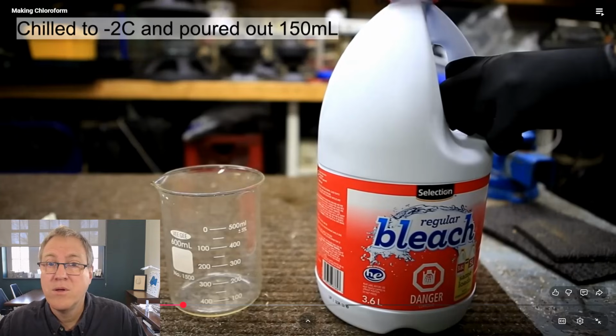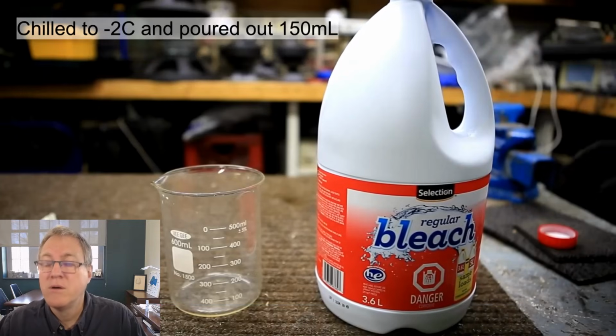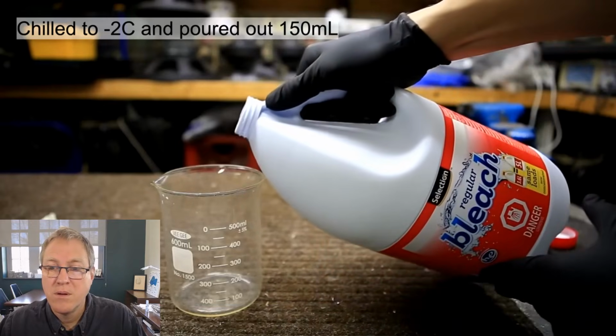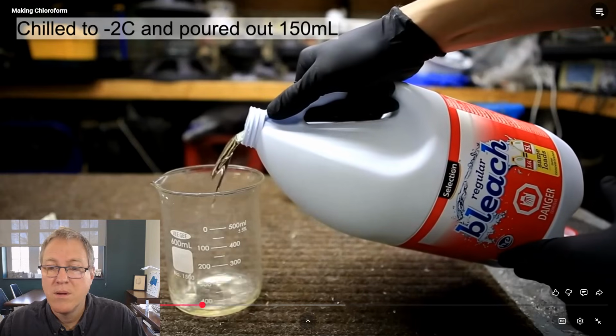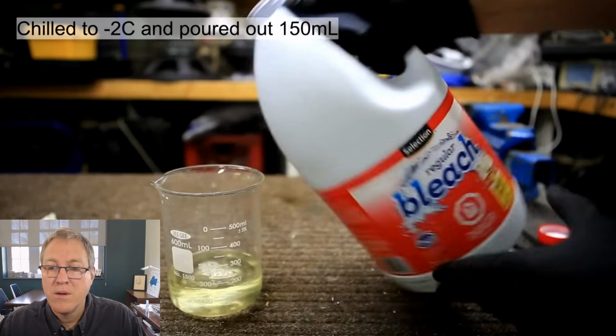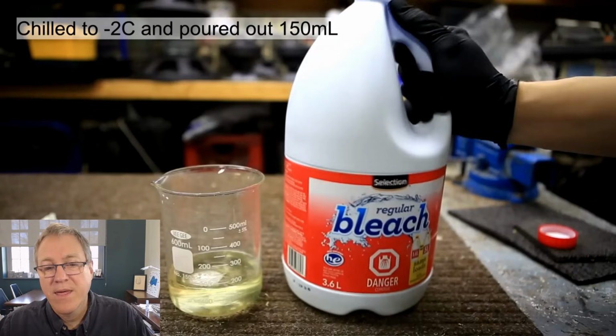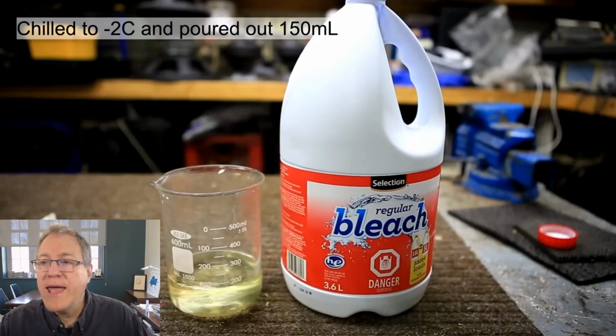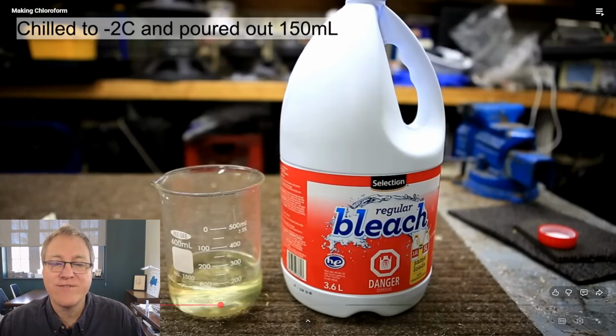The bleach was chilled to about -2 degrees Celsius and 150 milliliters was poured out. 150 milliliters is removed to make sure that it has enough space to add the acetone as well as to shake it. The reaction of bleach with acetone is extremely exothermic, and it's absolutely necessary to cool it to at least 0 degrees Celsius before. Okay, so he needs this cold, and he needs a little bit more room in this bottle. So he's going to add 100 milliliters of acetone to this, and he needs some space in the bottle. So he's going to pour out a little bit of bleach to make space for that acetone.